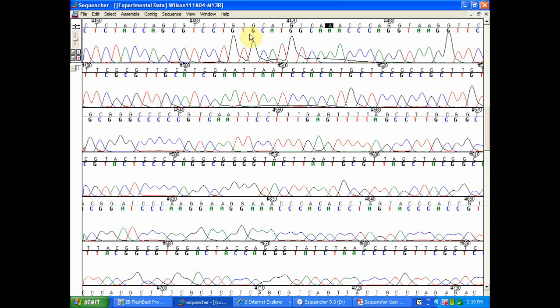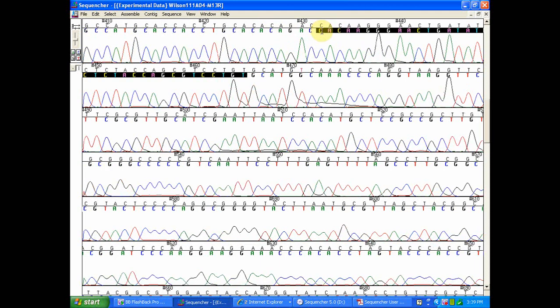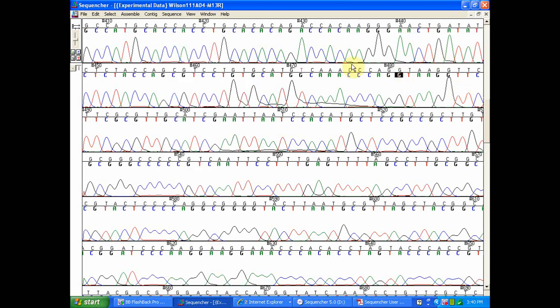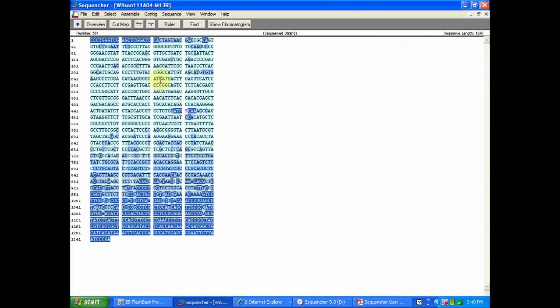If at any point during this editing process you feel like you've made any erroneous edits, Sequencher makes it very easy to revert to your experimental data. Notice that all the experimental or raw nucleotide sequences on the underlying position, you can highlight it, go to your sequence menu, and simply hit revert to experimental data. As I've made all the edits I'd like to make here, I'm going to go ahead and X out. That is a good way that you can use your chromatogram or raw trace information to improve the quality of your raw sequence data.